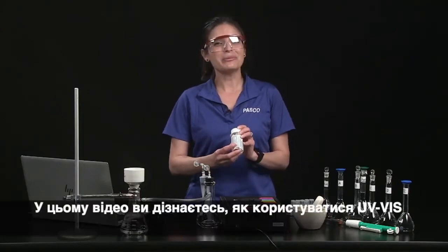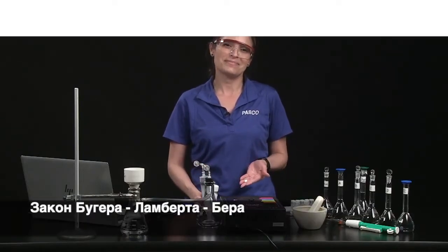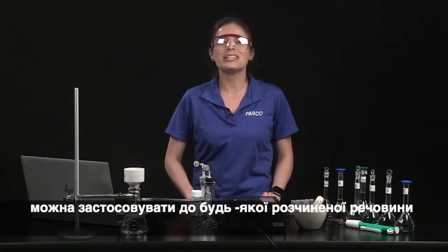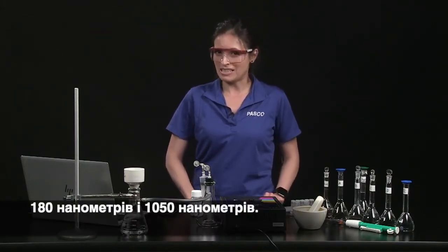In this video, you will learn how to use PASCO's UV-Vis spectrometer to analyze the aspirin content in an aspirin tablet as an application of Beer's law. The solution preparation and analysis techniques in this video can be applied to any one-solute solution that absorbs light between 180 nanometers and 1050 nanometers.